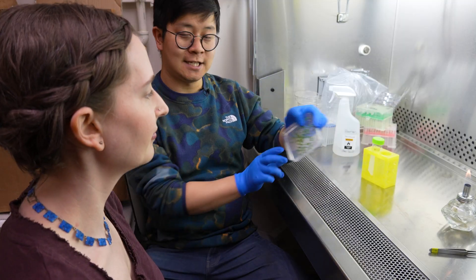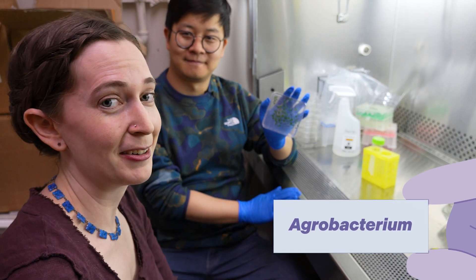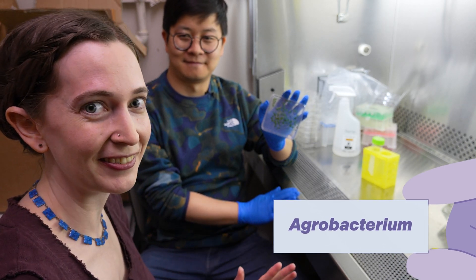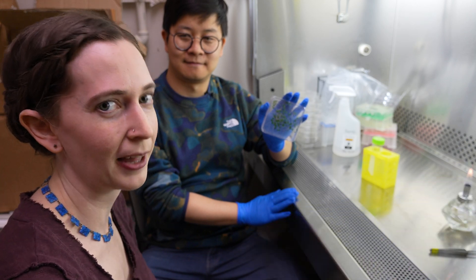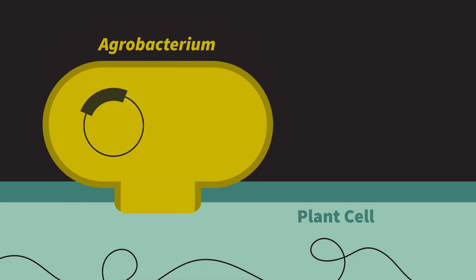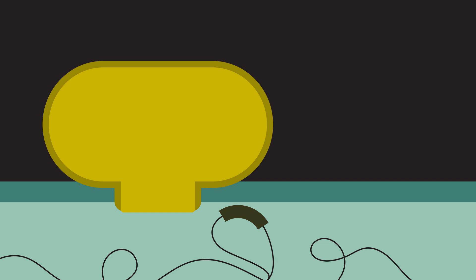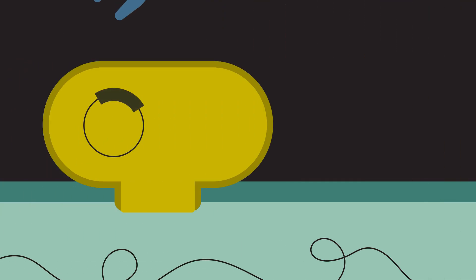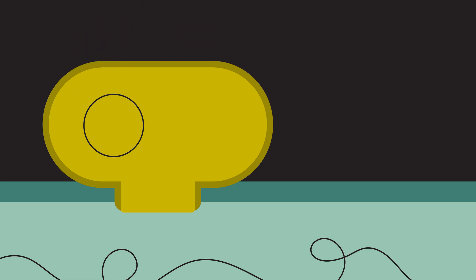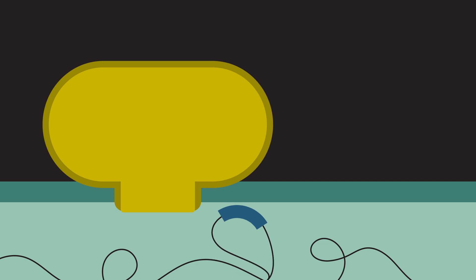Aren't they so cute? And for today's transformation, we're going to use Agrobacteria. You've met Agrobacteria many times in my previous videos. This is a bacteria that's naturally evolved the ability to transform plant genes. Agrobacteria is able to insert its own genes into a plant's DNA, which instruct the plant to make food and housing for the bacteria. But scientists can swap out the house and food genes with genes that they want to study, and the Agrobacteria will insert those genes into the plant DNA instead.